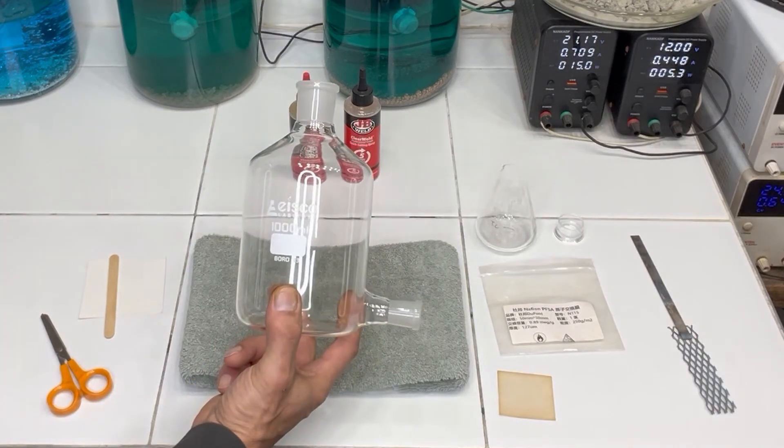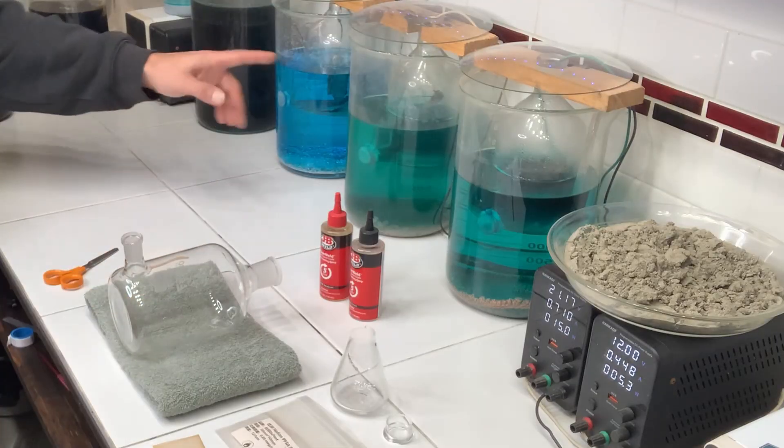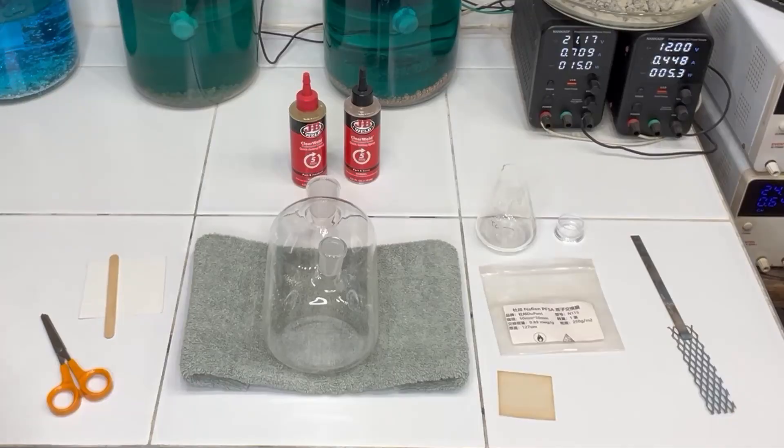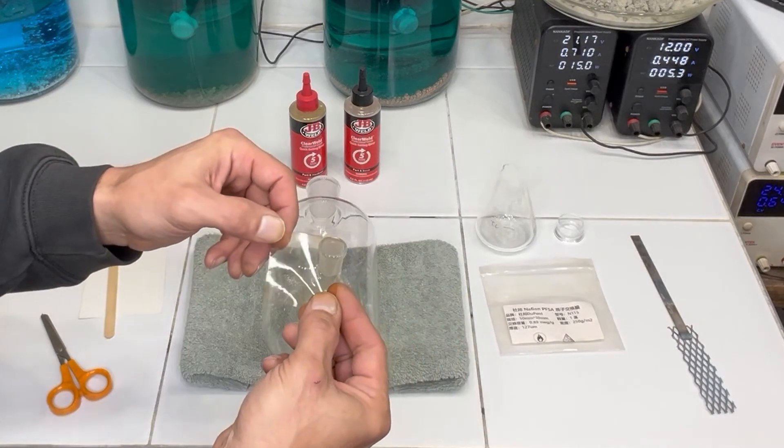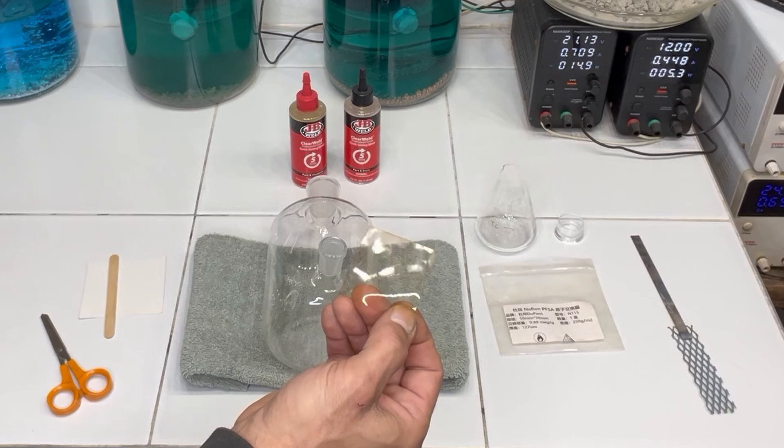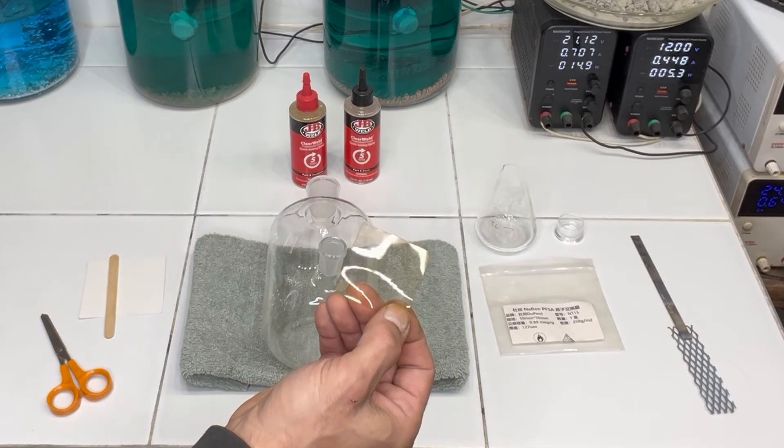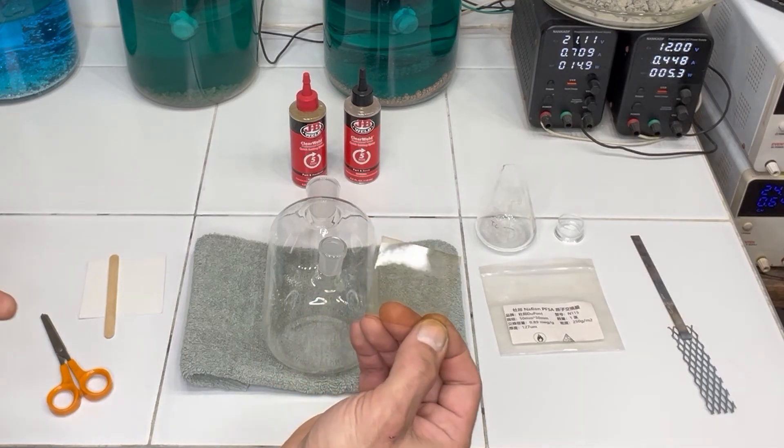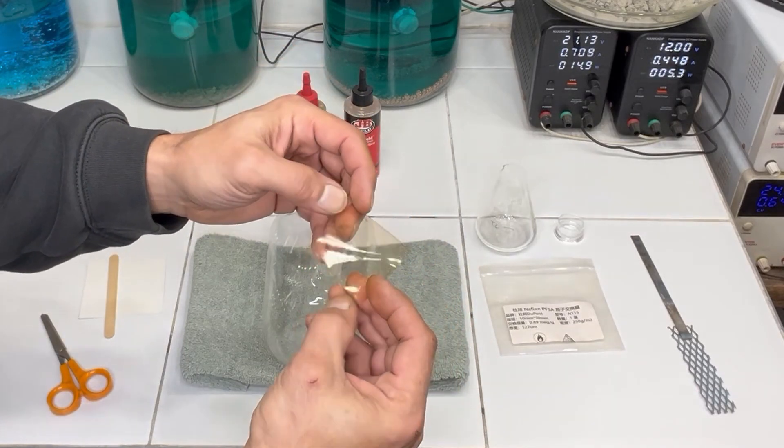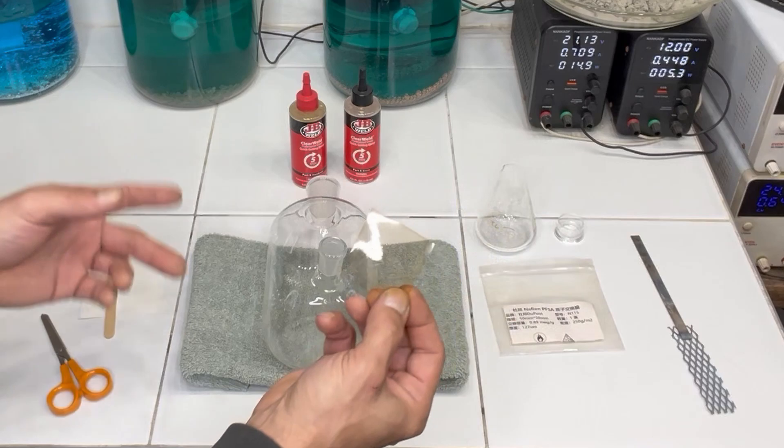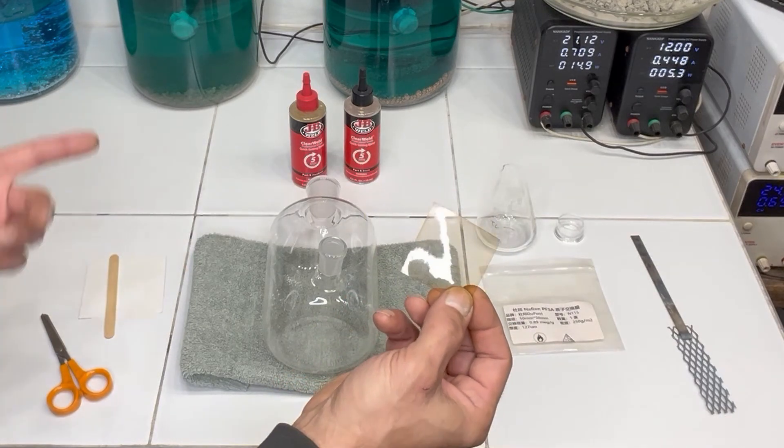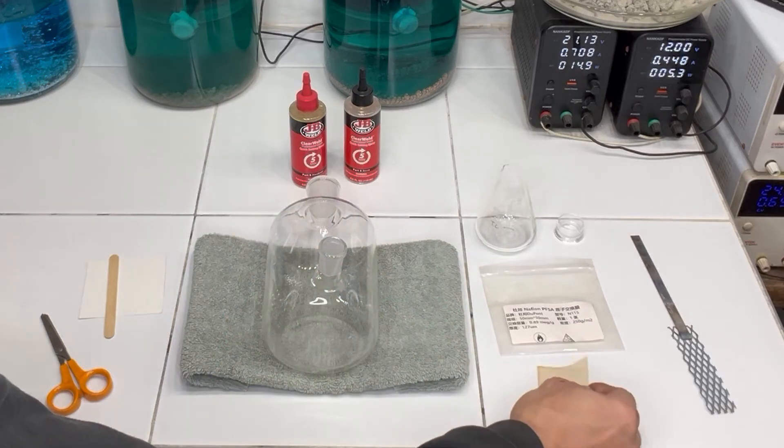I'm using an aspirator bottle, the same aspirator bottle that I use in all of my cells back here, the silver cell and the copper cell. I've purchased this 50 millimeter by 50 millimeter piece of nafion membrane which is a perfluorosulfonic membrane. It's typically used in fuel cells or very high alkali environments. So this is a perfect material. There are other materials you can purchase but this actually has proven to be very effective for this experiment.